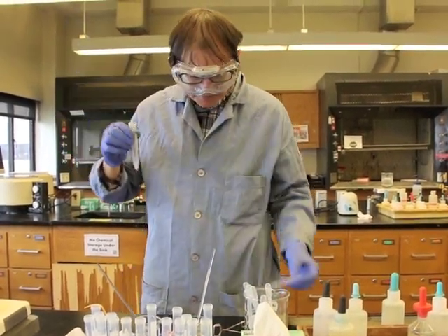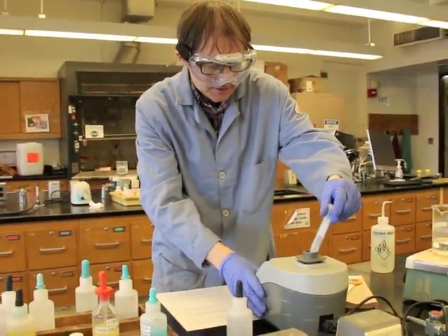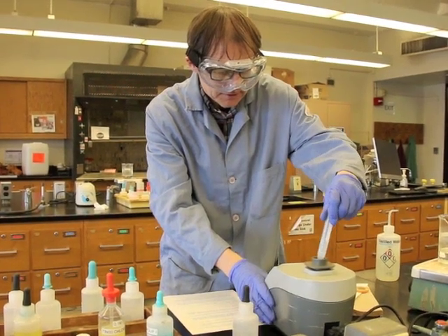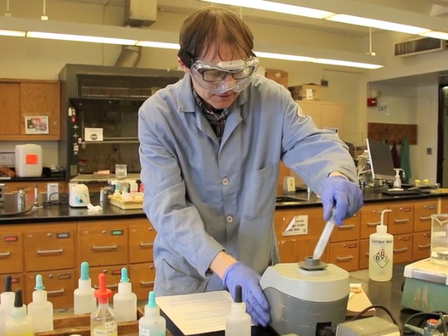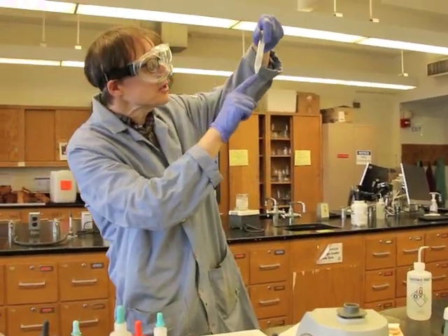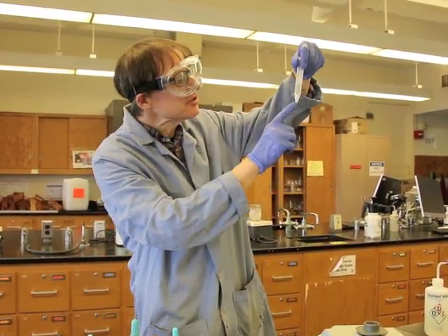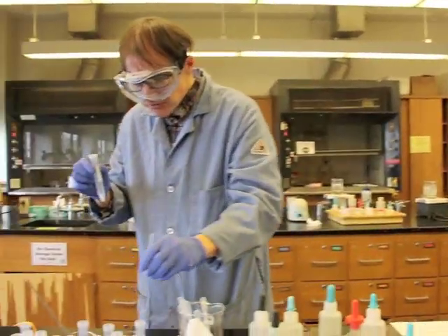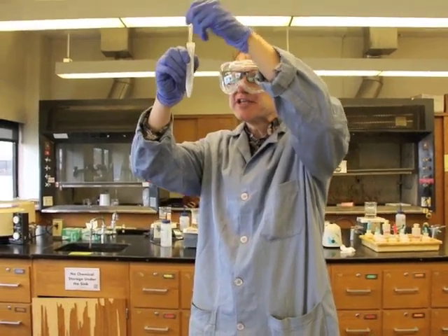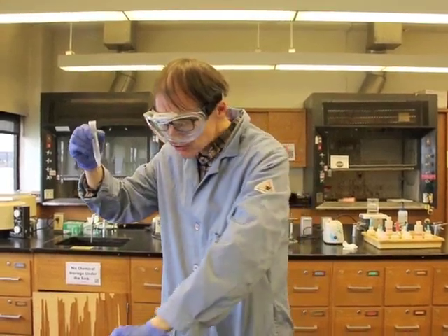So I'm adding the water, and then what I'm going to do is I'm going to stir it. Mix it up really well. Now you may notice there's a little bit of solid down there at the bottom. So one way we could deal with that is just to keep vortexing it, or we could go back to the old-fashioned way, come back over here to the glass stirring rod, and do a little physical agitation that way. Sometimes the old-fashioned technology is a little faster than the newer technology.